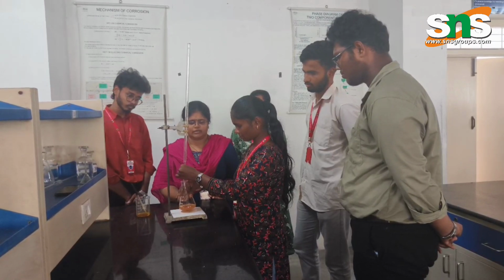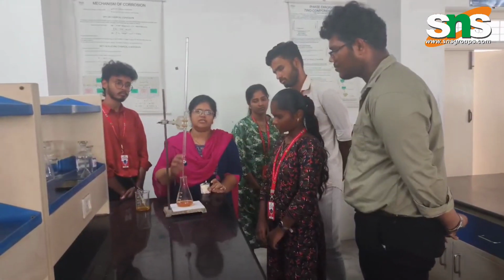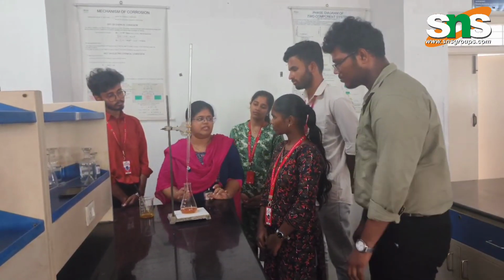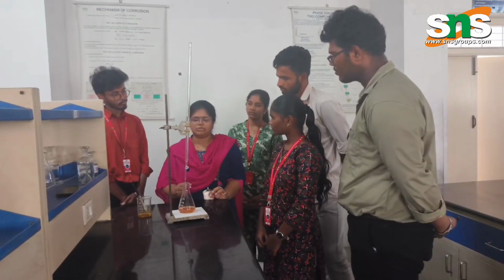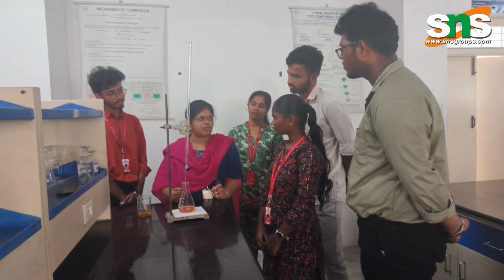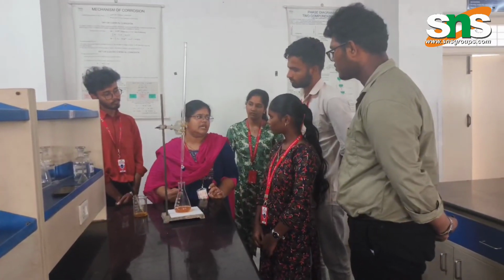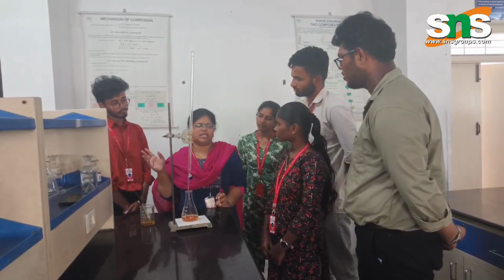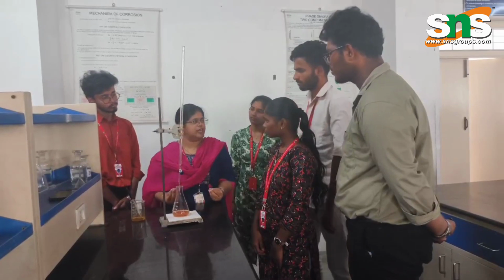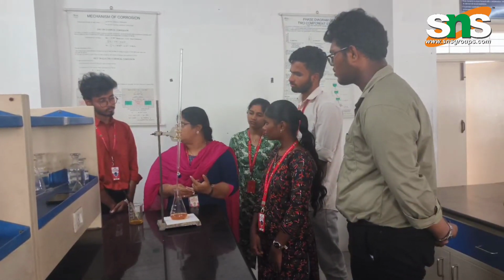Now you got the end point. You have to note down the reading. You are getting the end point very soon, so it has a small amount of chlorine because it is RO water. When you take sample water from other places, like municipal water, what you get in the houses, they will add more chlorine.